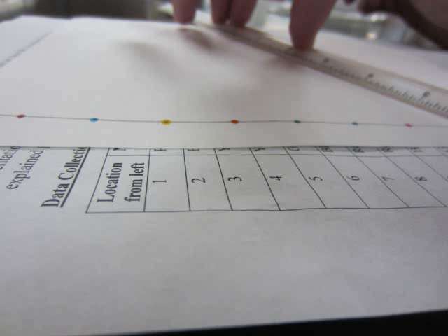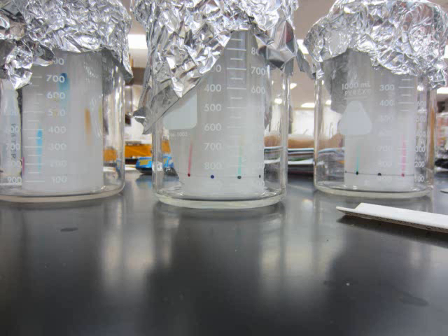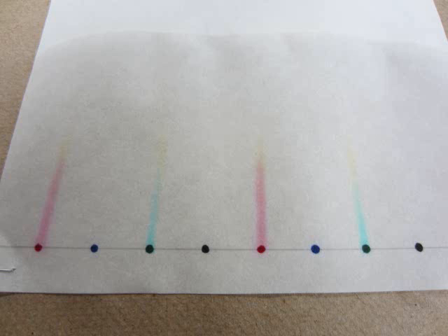One of our random errors was when you put the dye on the paper with a toothpick or you dot it with a marker, the human hand can't place the toothpick or the marker on the same spot each time. And so therefore the dyes and the ink are not perfectly concentrated on one spot. This could cause the dye or ink to travel further or less up the paper. We could fix this by doing more trials to average out the slight inaccuracy. And those were our random and systematic errors.